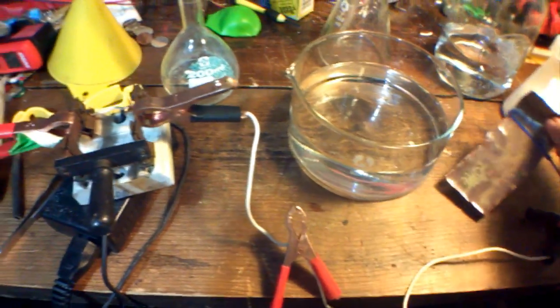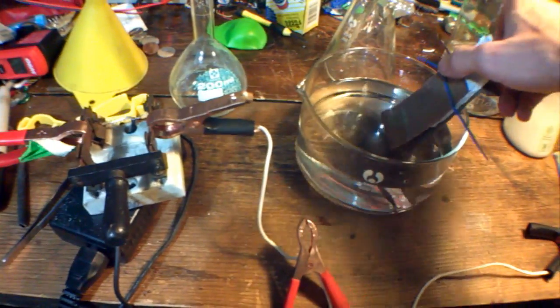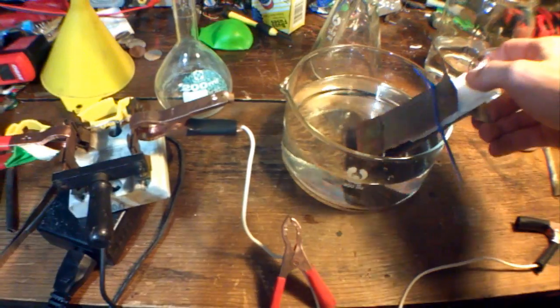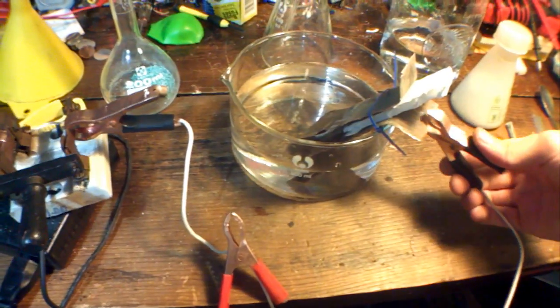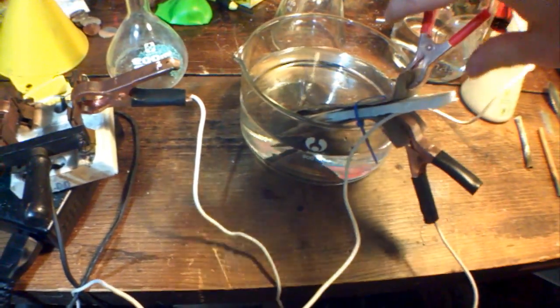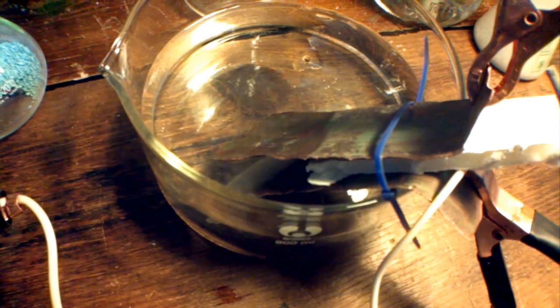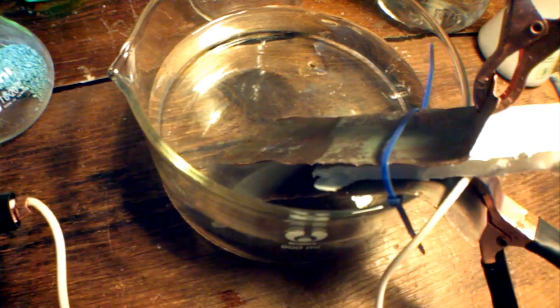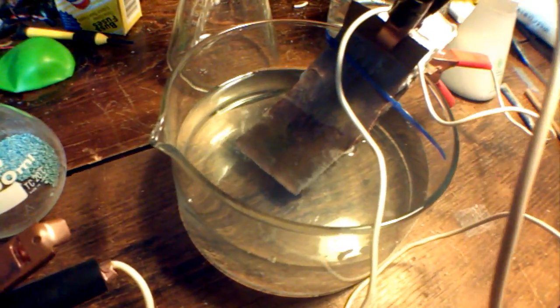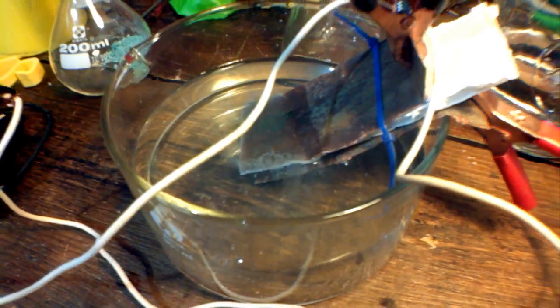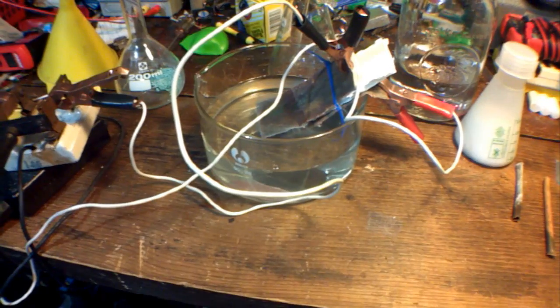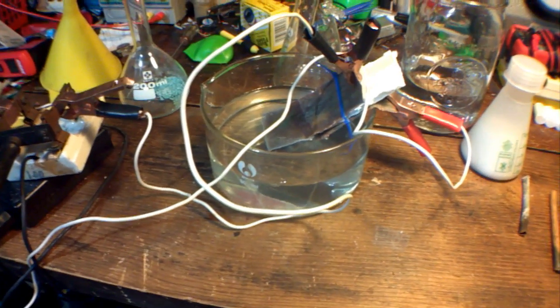You can see it's bubbling there. We'll let that sit and it should make the chemical all bluey.